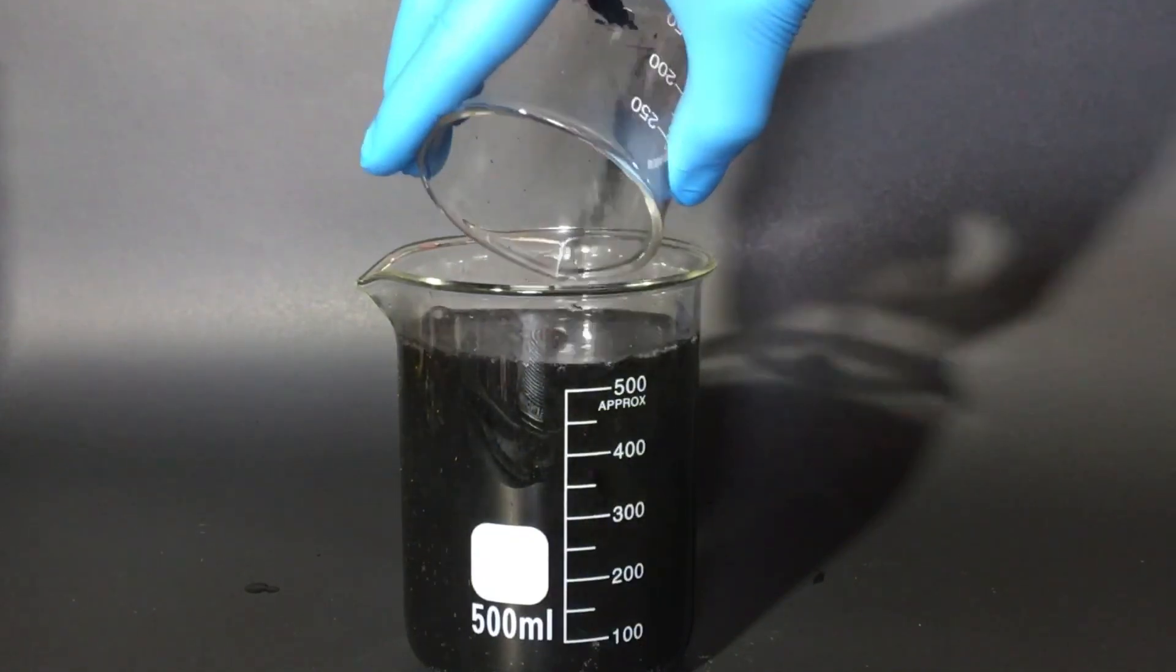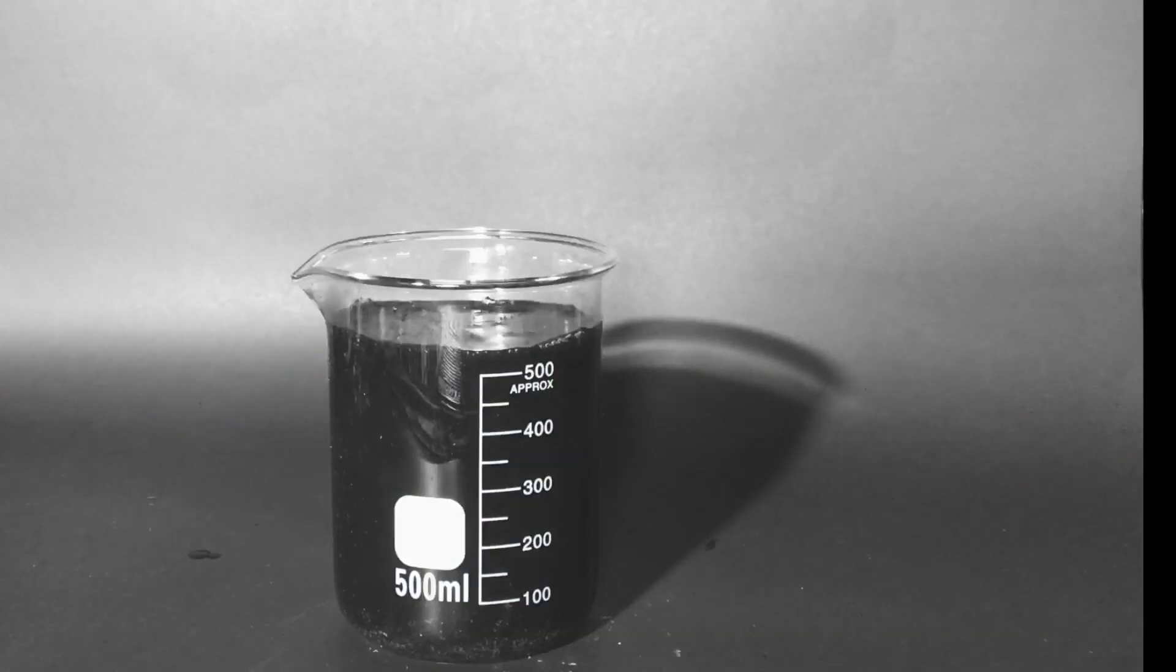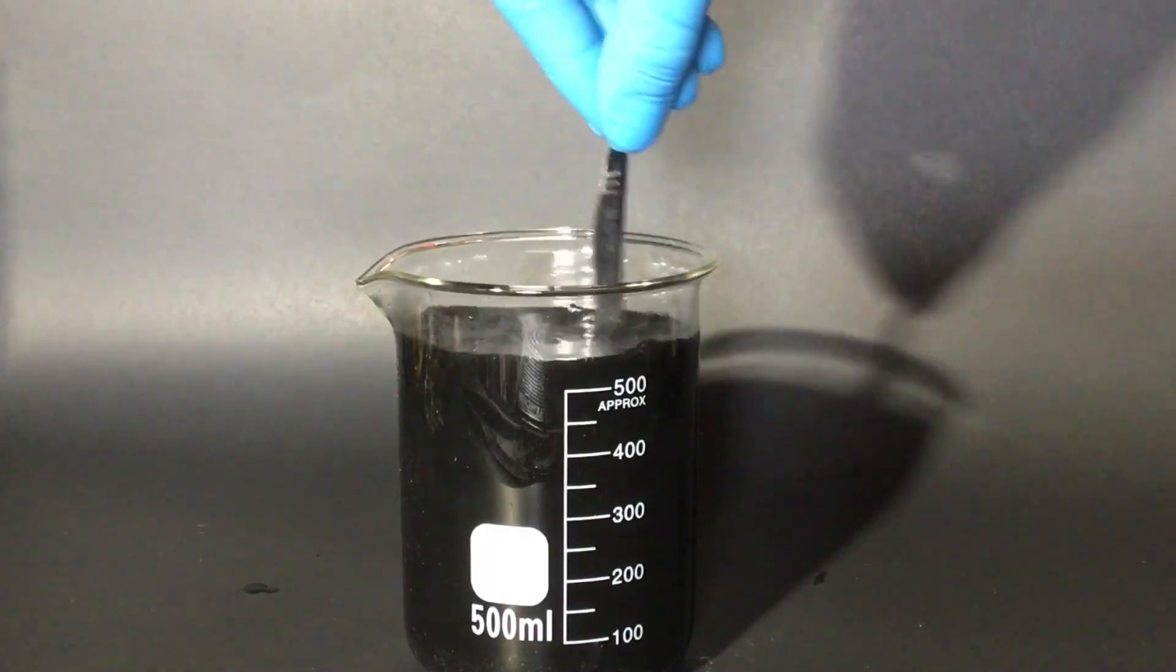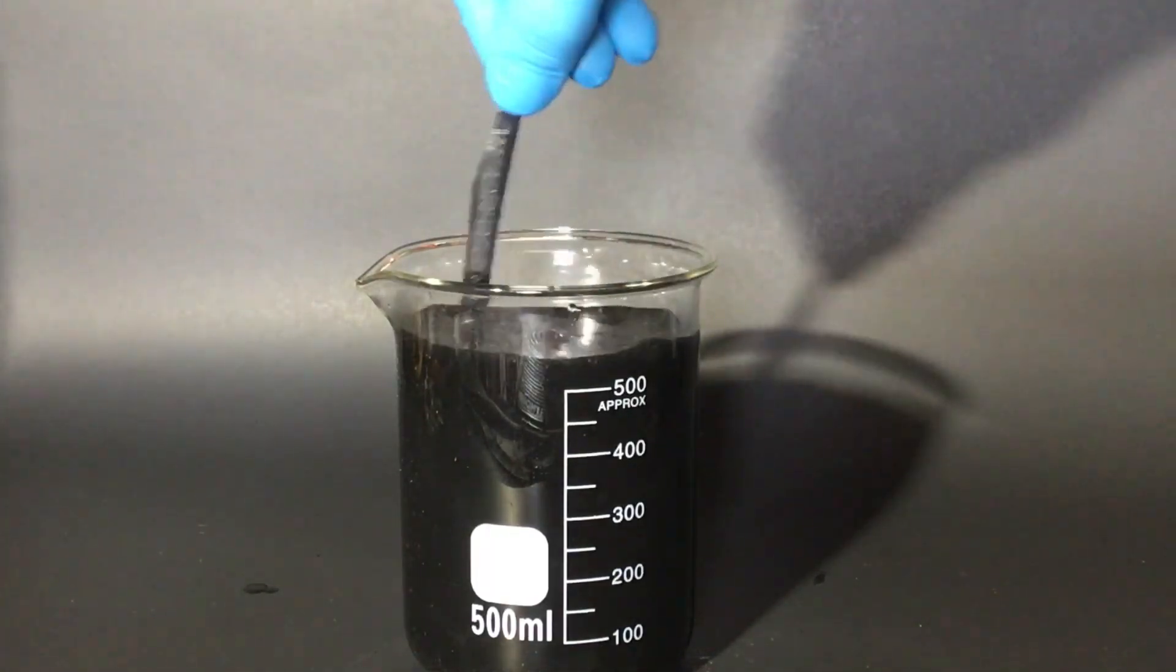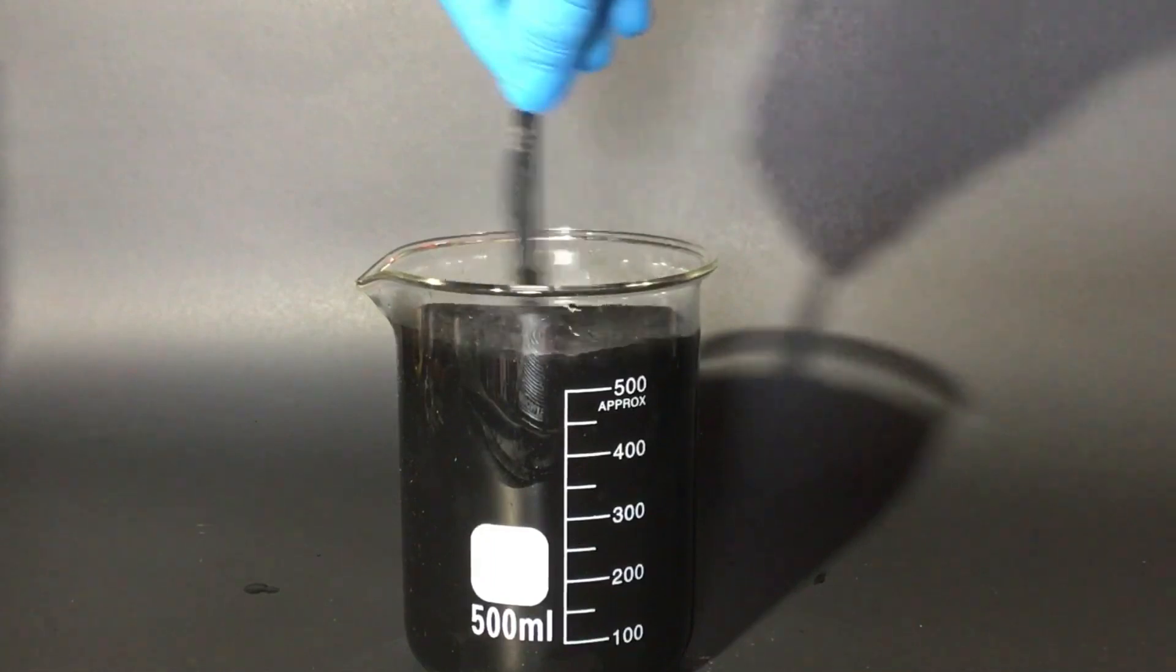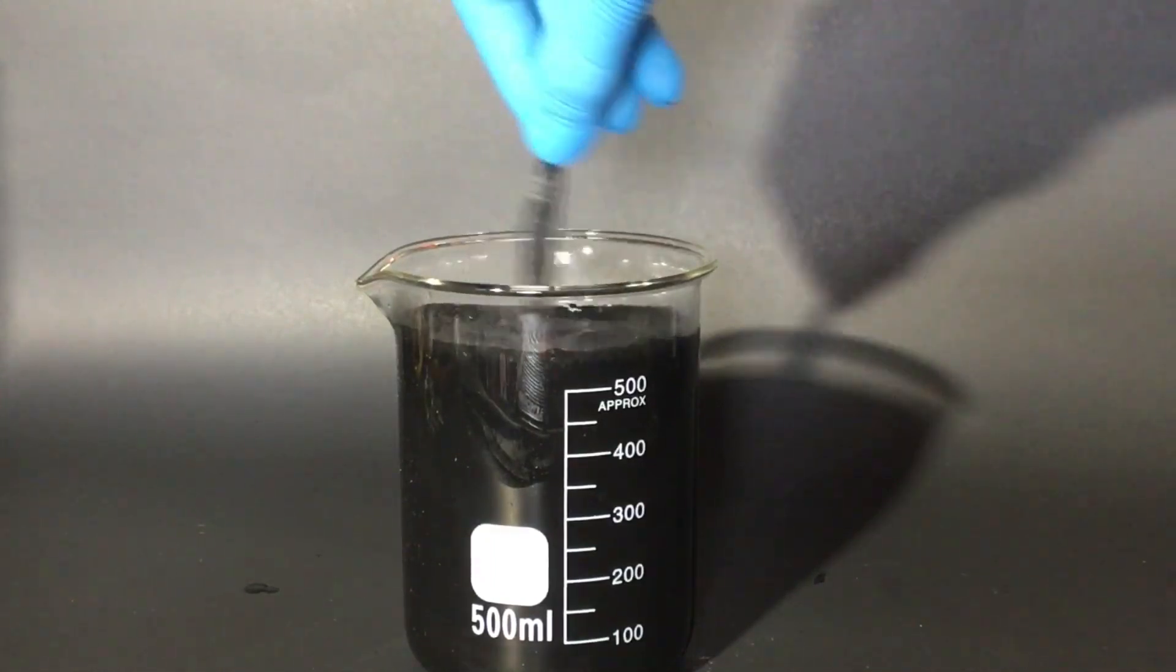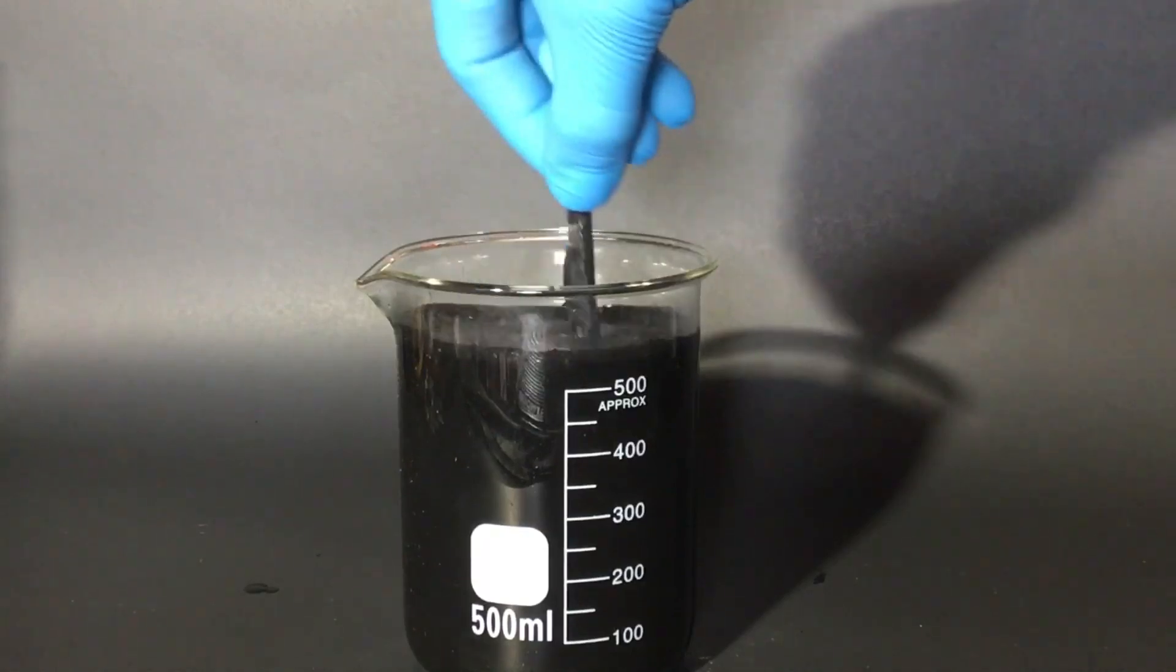They ask you how you are and you just have to say that you're fine, and you're not really fine, and you just can't get into it because they would never understand. It's not turning into the characteristic purple color and it still smells like bleach. The procedure I'm following is from a random Wikipedia article and I don't even know if it's right.